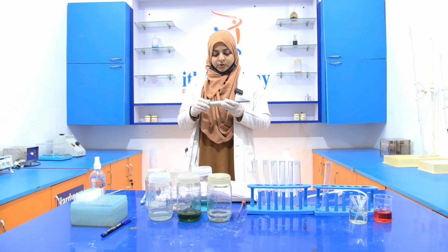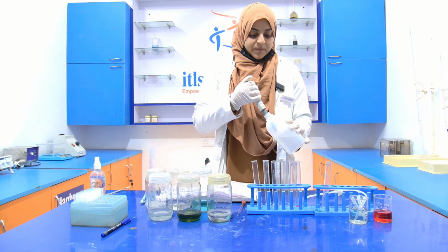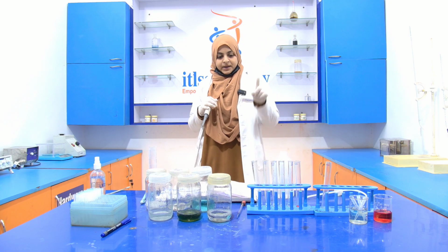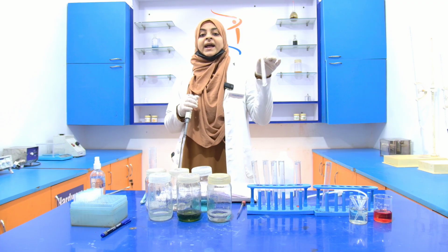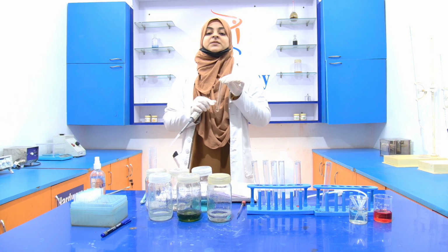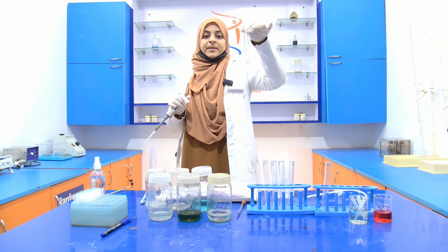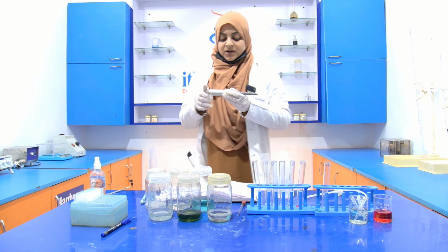So we have to add 200 microliter or 0.2 ml distilled water to make up the volume to 1 ml. Now in the fifth test tube, we are not going to add any distilled water because here already 1 ml of BSA is present. So its volume is 1 ml. Now in the sample, 0.2 ml of the sample is present. So I am going to add 0.8 ml of the distilled water into it.